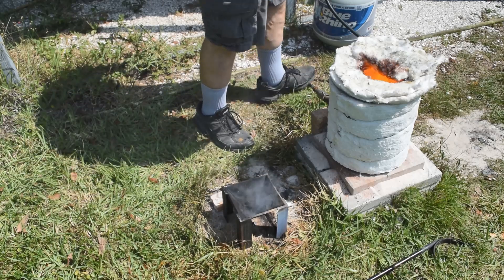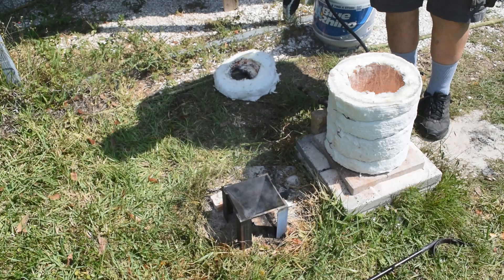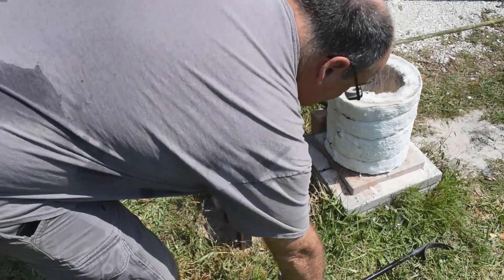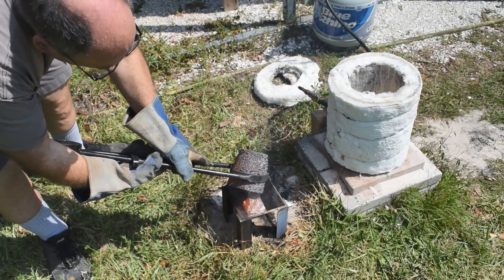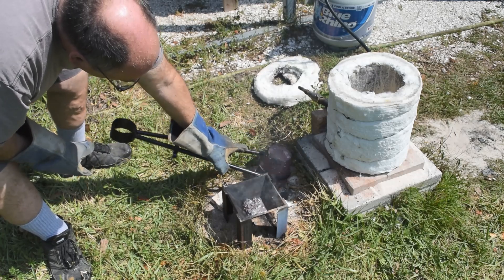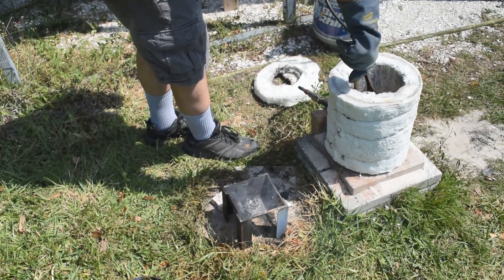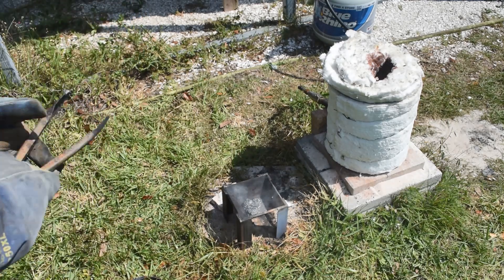Well, this is for all the marbles. I'll give that a minute or two to cool down and harden and put it in front of my big shop fan. We'll get it cooled down to where we can dump it out and see what we got — hopefully there's a little button of tin in there.